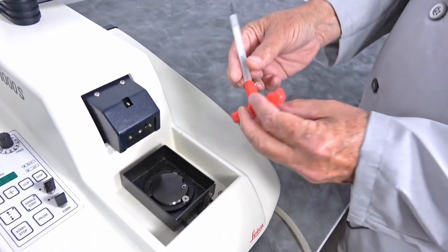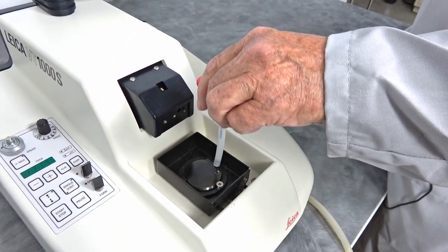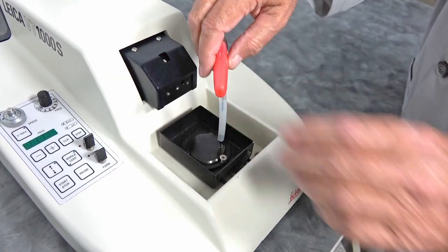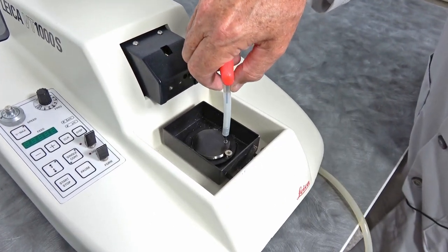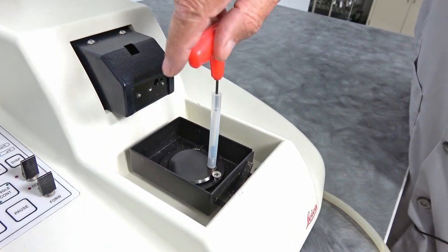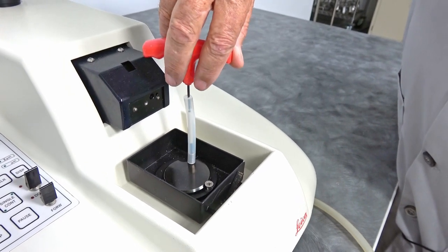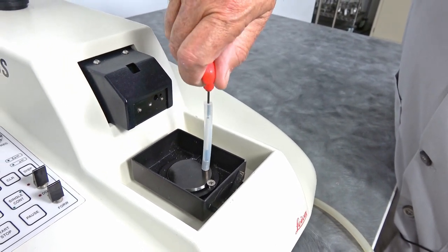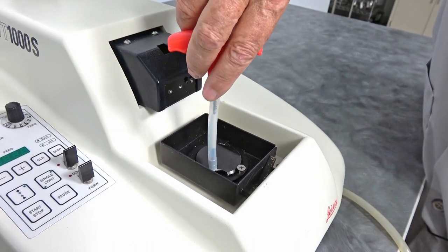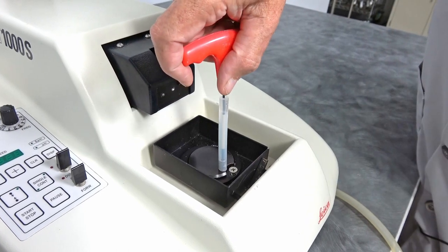We had to manufacture this tool, which is a fancy Allen handle. It goes into a receiver. You push it down. It gives you the ability then to turn. In the manual, it says you can place that opening any place you want on that stage, except where that screw is or where those ears are.